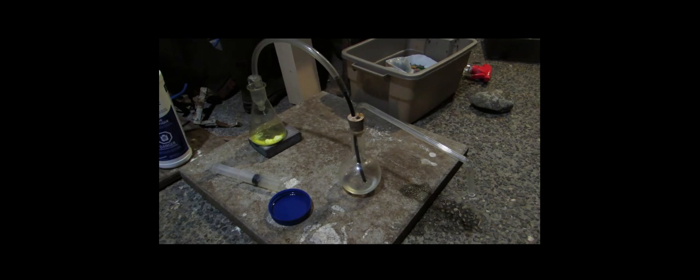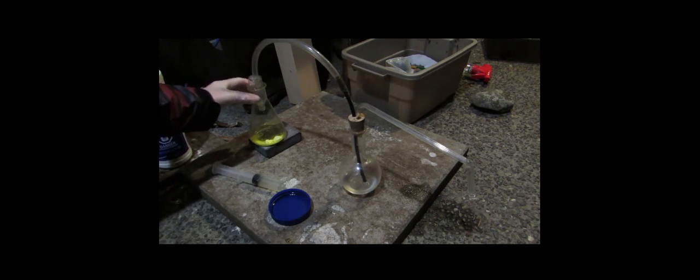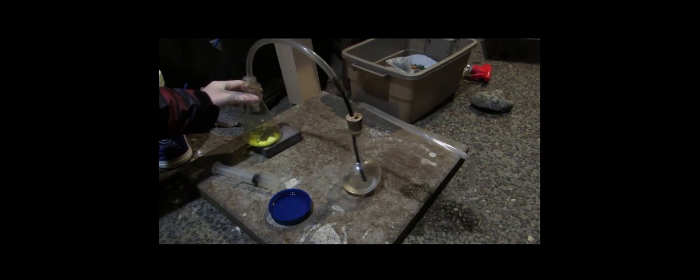Now, let's see if anything's going to be happening. Chlorine gas is definitely being generated. So, it's bubbling through. This is probably all normal right now, though. I'll be back and tell you if anything happened.